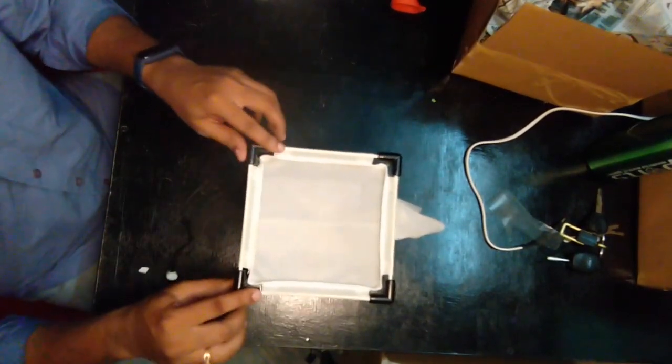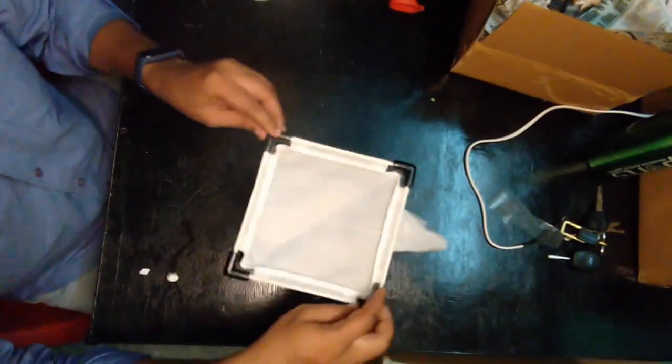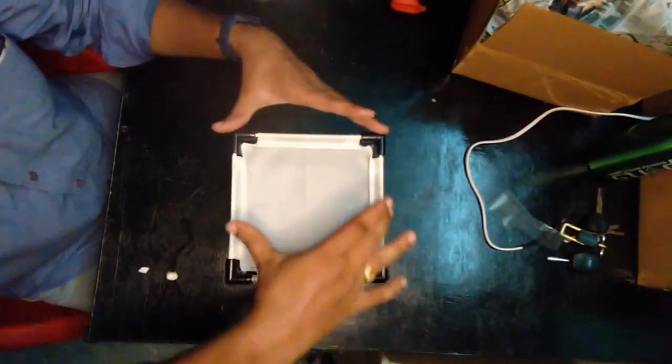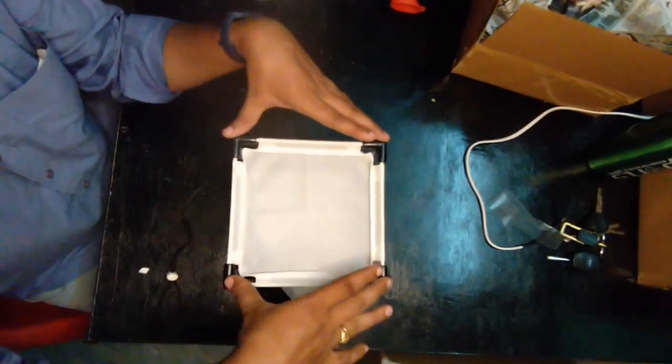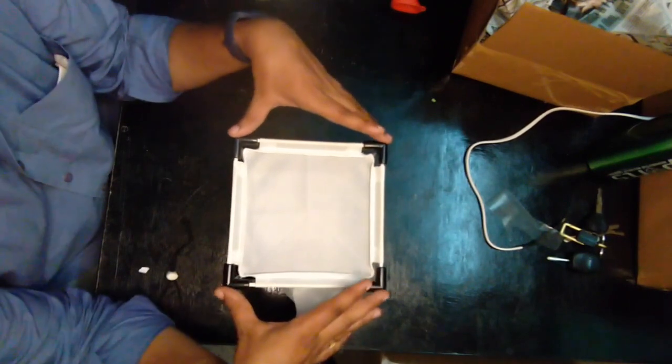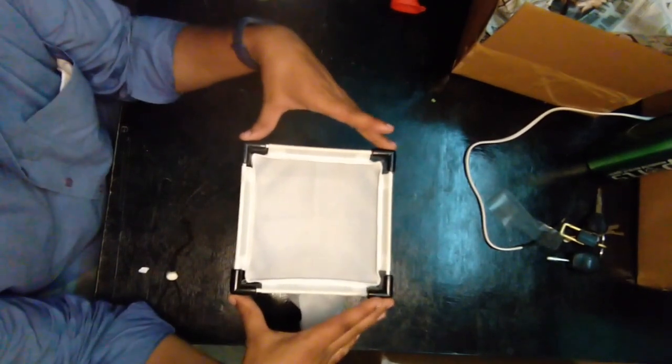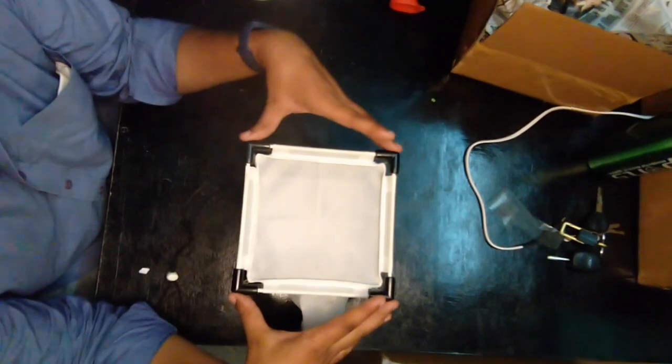If the cage is properly installed, when you see from all sides you will have a perfect square inside, and the cage should not have uneven surfaces.